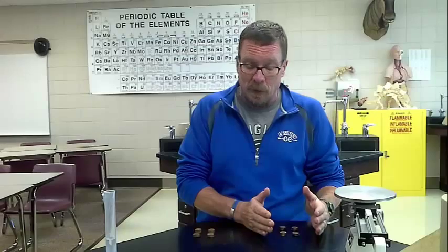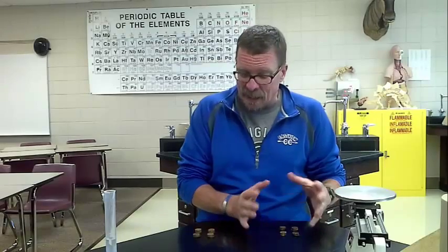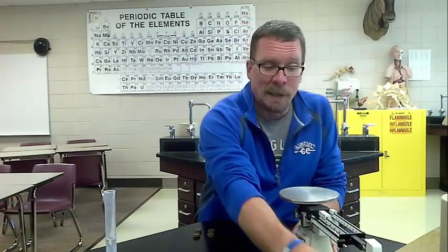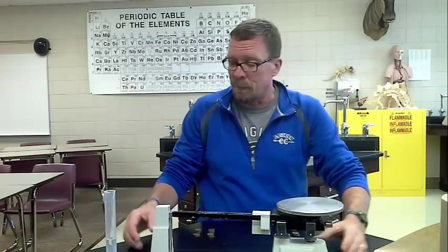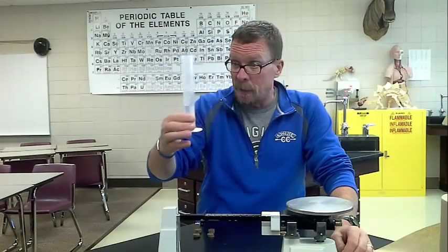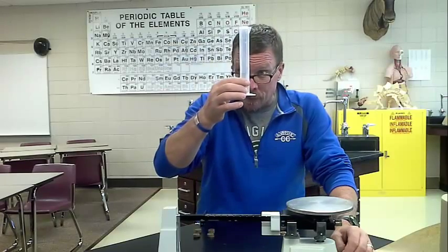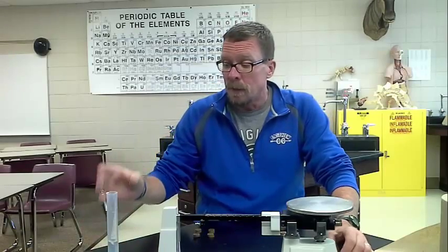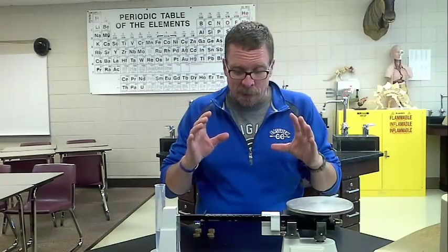These are from 1984 and after. These are from 1982 and before. I have a triple beam balance here that I'm going to use to get the mass. And I have a graduated cylinder. I just took some tap water, and as I read the bottom of the meniscus, I have about 21 milliliters of tap water in it. What you're going to do in class is measure the density of the pennies from these different time periods.